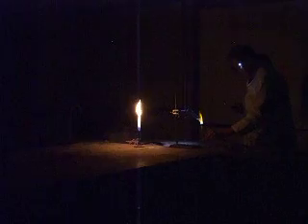Anyone ever eaten a packet of jelly babies? Now, there's an awful lot of energy inside one of these jelly babies, as this next experiment will show. So I've just been heating this in front here, quite casually. Again, I've heated this, I've turned it from a solid to a liquid. I'll get it really hot.